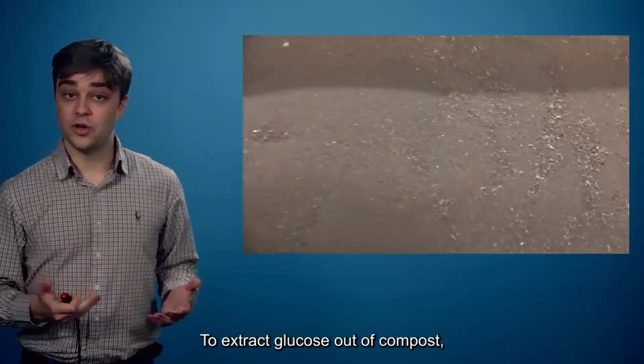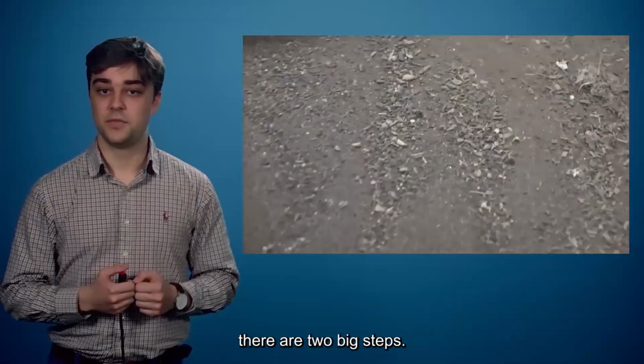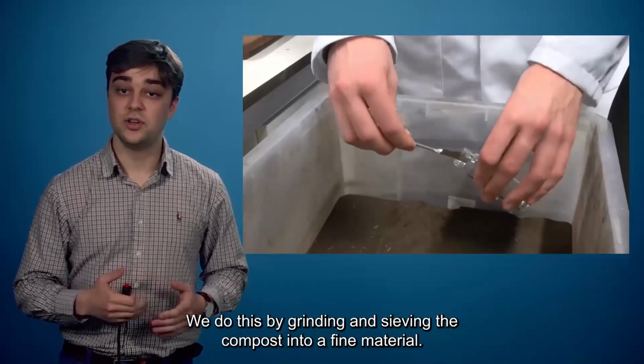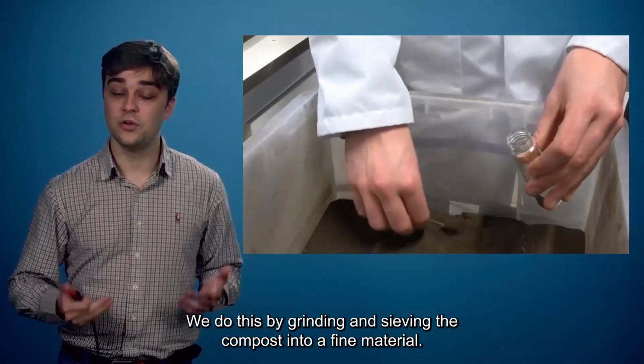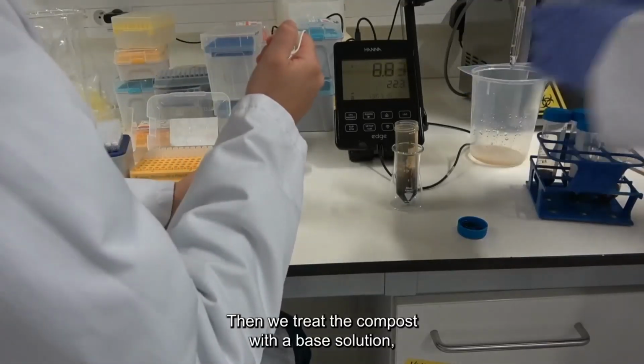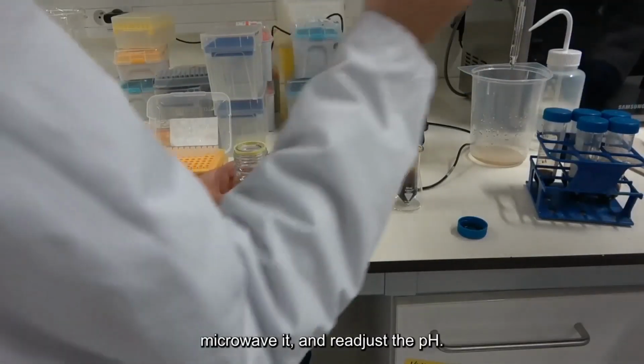To extract glucose out of compost, there are two big steps. First, we need to break down the compost into polysaccharides. We do this by grinding and sieving the compost into fine material. Then, we treat the compost with a base solution, microwave it, and readjust the pH.